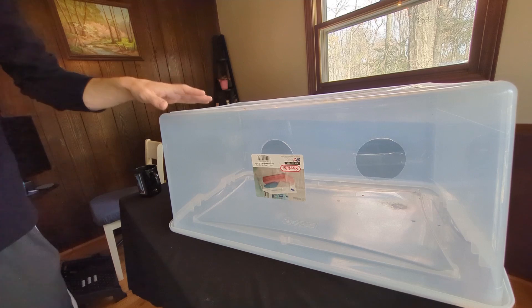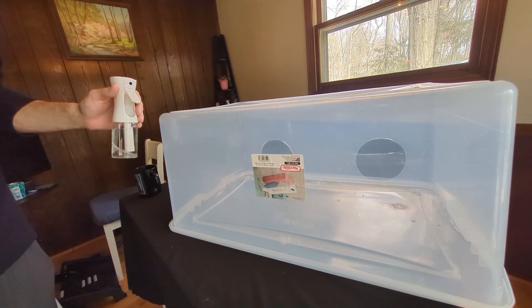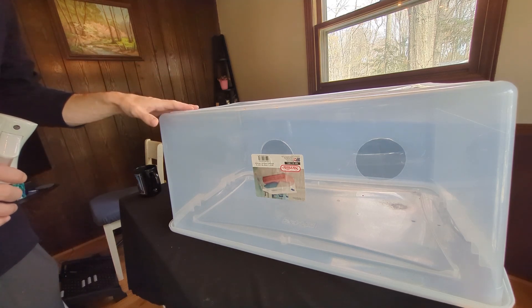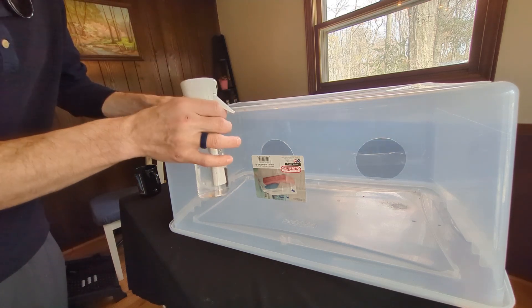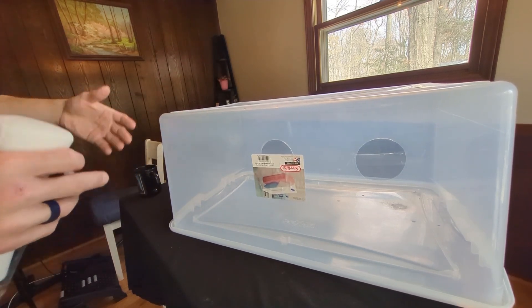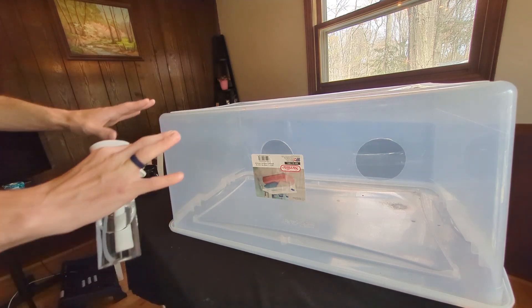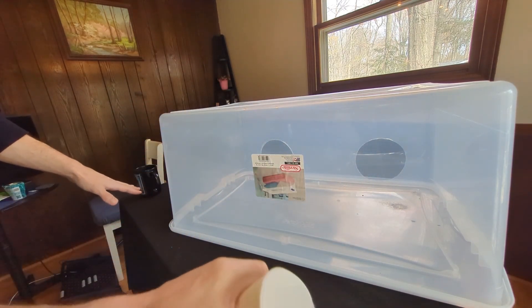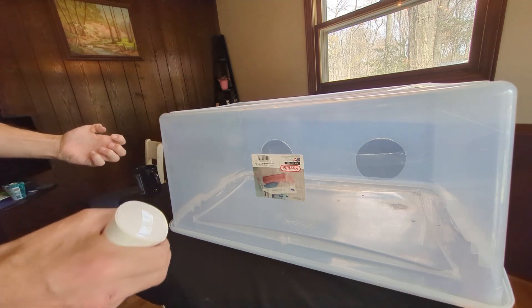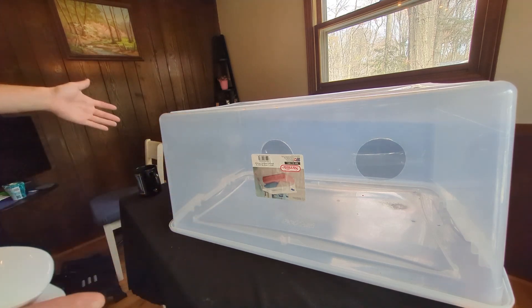We do have to clean this very well — disinfected using 70% isopropyl alcohol, or some people use a 10% bleach solution. I've not used bleach, so if someone out there uses bleach, please chime in and tell me the percentage and your recipe. I just use a little spray bottle — these small misting bottles are super nice. Before you get started, you're going to douse everything with isopropyl alcohol, outside and inside, including your workstation. Spray everything down, let it sit until it dries if you can. I go overboard — I'd probably wipe everything down, spray it, let it sit, wipe it, spray it, let it sit until it dries, and then do my work.